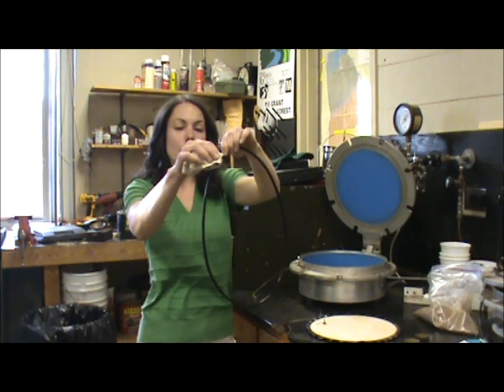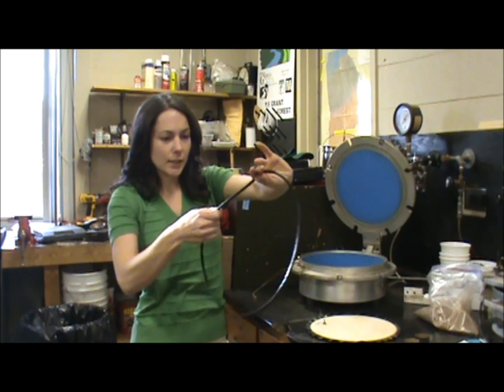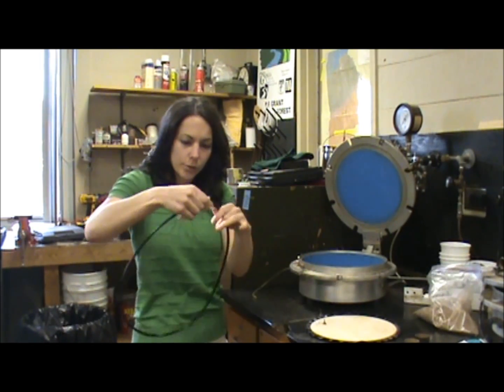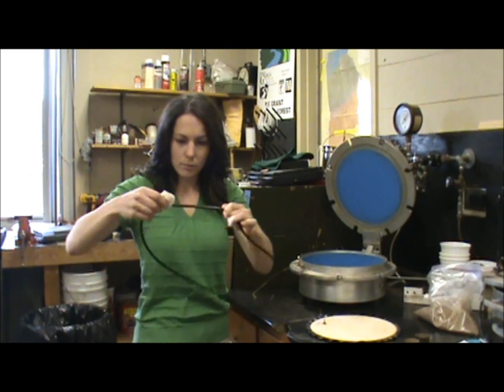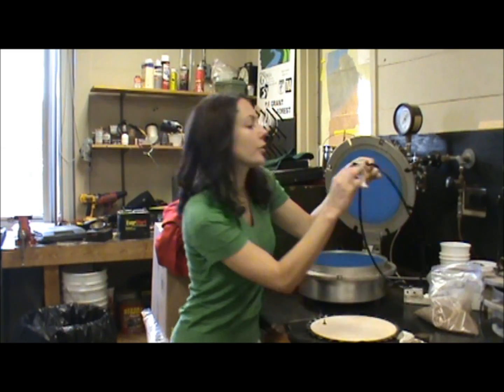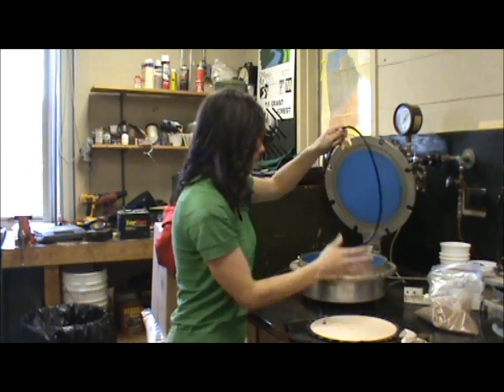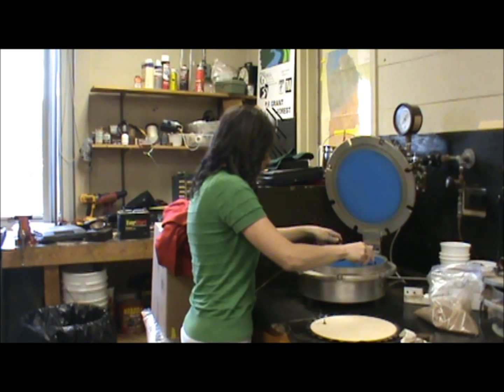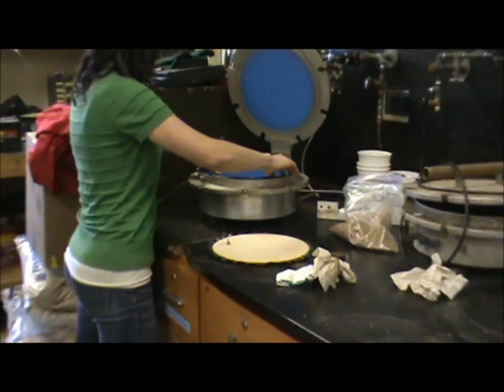This has one really large o-ring, and you want to make sure that there isn't any dirt, sand, or soil on it — that you clean it really well. Then you take vacuum grease and you're going to cover it around the entire ring, and you place it right into the top. This is going to make a seal once you close the lid.